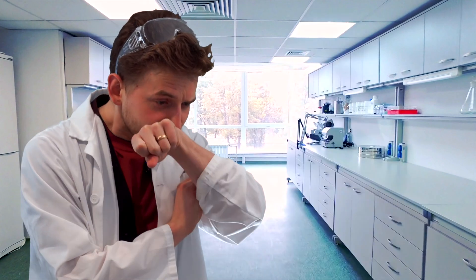So you're just there mixing up a nice batch of copper carbonate, and suddenly it splashes and gets on your skin — what do you do? Do you go to the hospital? Do you lick it? No, don't lick it. You just rinse it with water. You dilute it. That's it. But I'm going to show you exactly what happens so you can be prepared. Do as I say, not as I do. And don't be dumb.